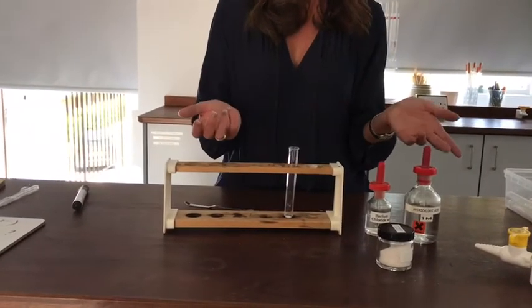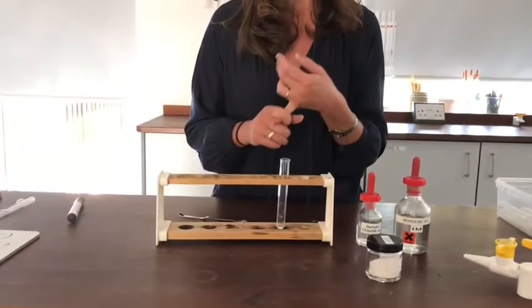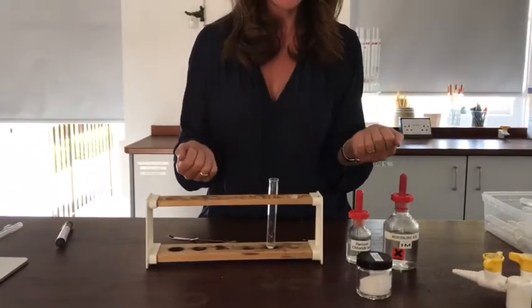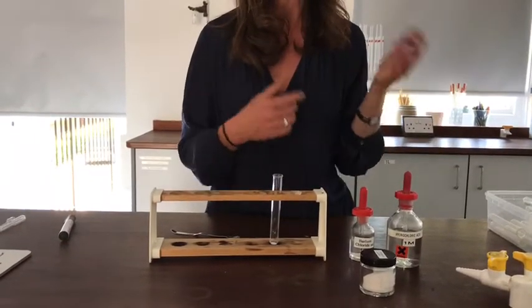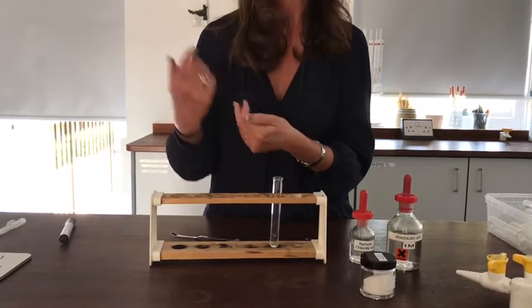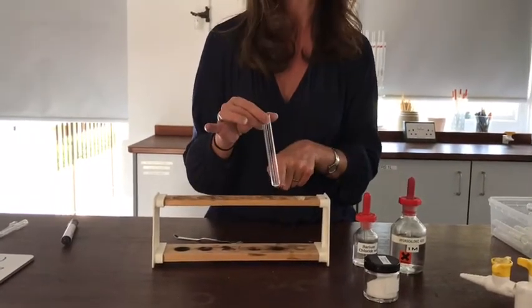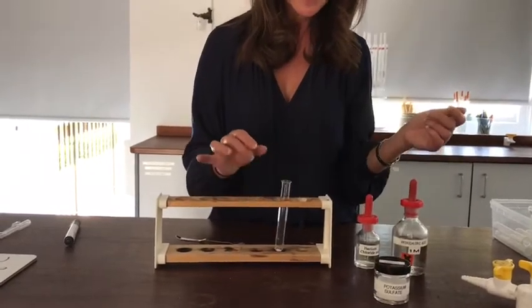The way to deal with that, always, is to add some acid. Now, acid should neutralise hydroxide ions because that's H plus and OH minus, which is a classic neutralisation. And also, we know from the previous test that acid reacts with carbonates, and I'd see some fizzing, so that would get rid of those carbonate ions as well. And that would mean that any solution I had left would have what was potentially my sulfate ions in it.